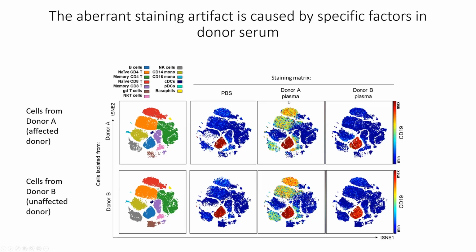If we now stain them in the presence of plasma from the affected donor, the artifact remanifests and it's transferable. So now the unaffected donor cells are showing this problem. And then reciprocally, if we stain the blood in the presence of plasma from the unaffected donor, the affected donor again no longer has the problem. So this isn't a cell intrinsic artifact. It's nothing to do with the cells themselves. It really does seem to be stemming from some sort of factor in the plasma of these affected individuals. Pretty unusual.